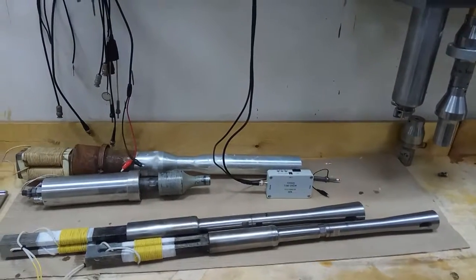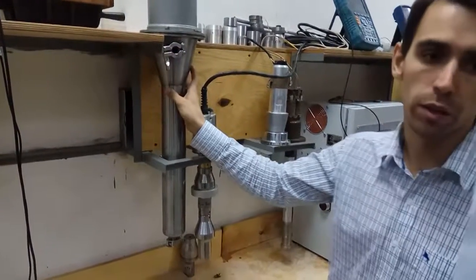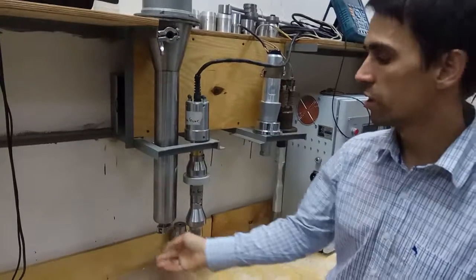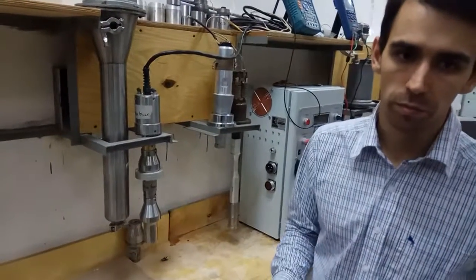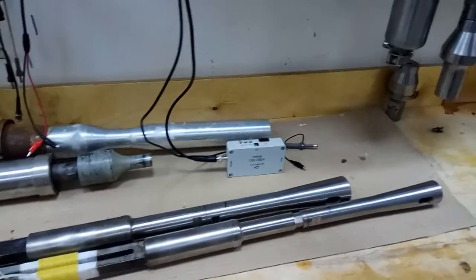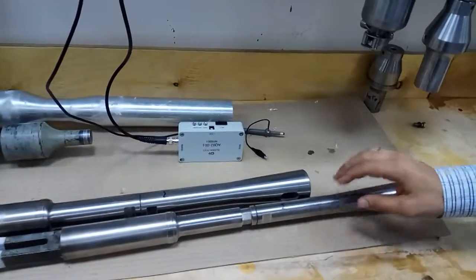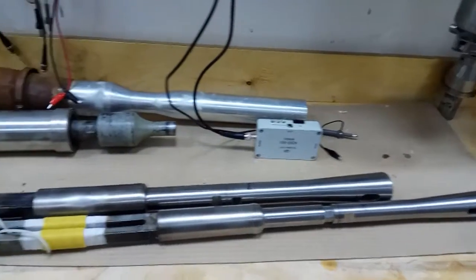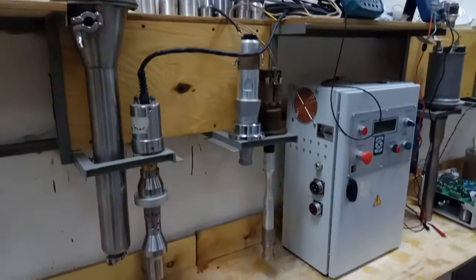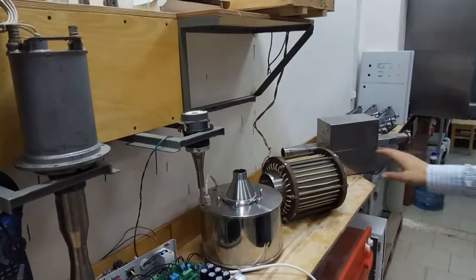Reactors tuned to different modes can be plugged in series. So this is a reactor with a case. This is the case. This is input. Here is output. The presented models differ in frequency and power. Some of them, besides cavitation, create a turbulizing effect. For example, these two types. Both magnetostrictive and piezoceramic transducers. This is piezoceramic, and this is magnetostrictive transducer. Here is piezoceramic too. So both types are used. There is a shell type.